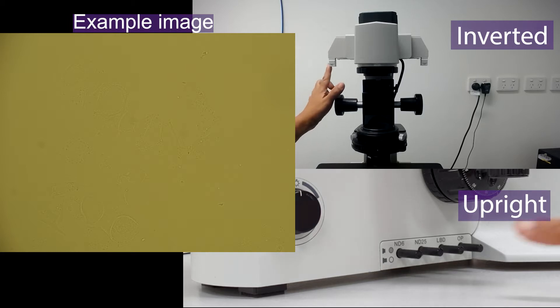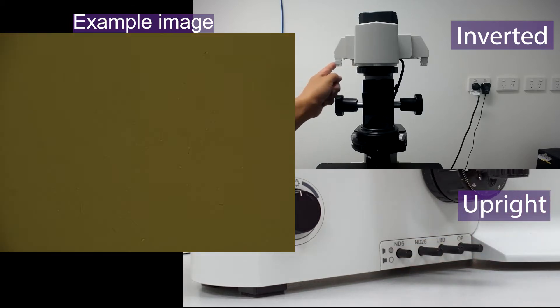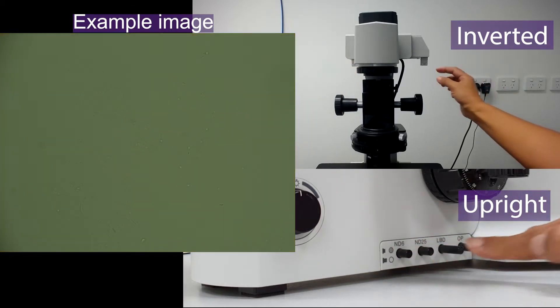Insert neutral density and color filters as required to achieve a good white balance background.